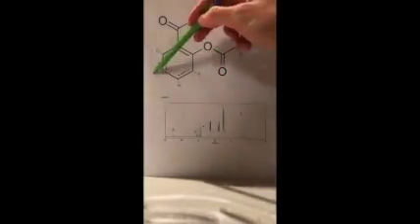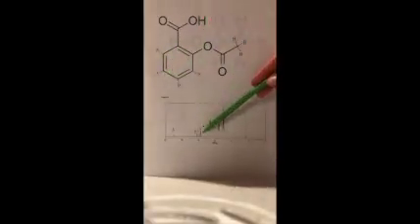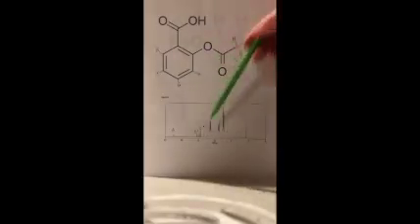And then these 2 hydrogens are going to be equivalent, and they correspond to the signal here at D, just because they are slightly more upfield, because they are further away from the oxygens, so they don't get their electrons pulled away as much as the other 2. And then lastly, we have these 3 over here, which are equivalent, and they correspond to this signal right here.